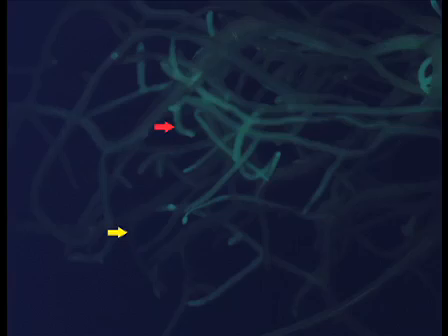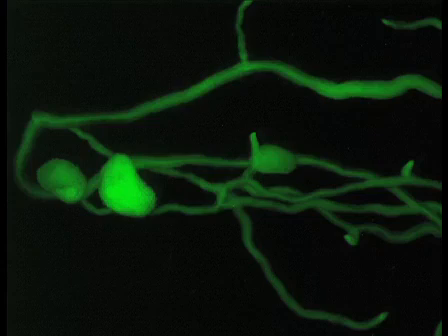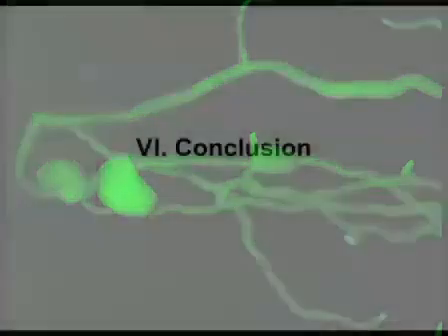This picture shows the GFP transgenic hairy root composite plants observed in the fluorescent microscope. The transgenic roots with the brighter green fluorescence are easy to distinguish from the non-transgenic roots. Nodules are formed in the hairy root of the composite plants. Here is the complete protocol.